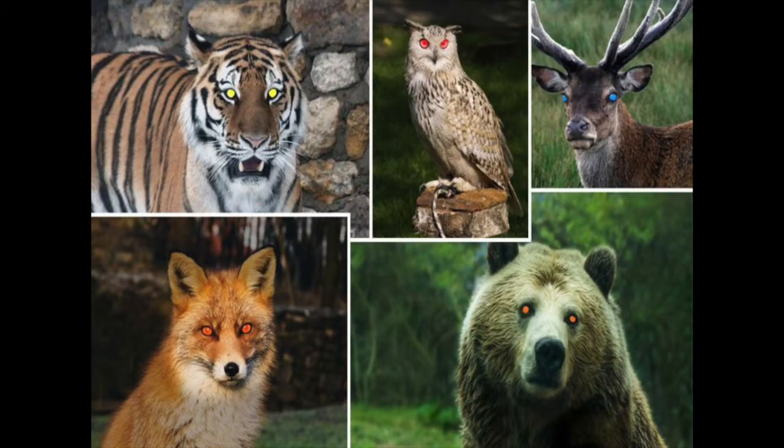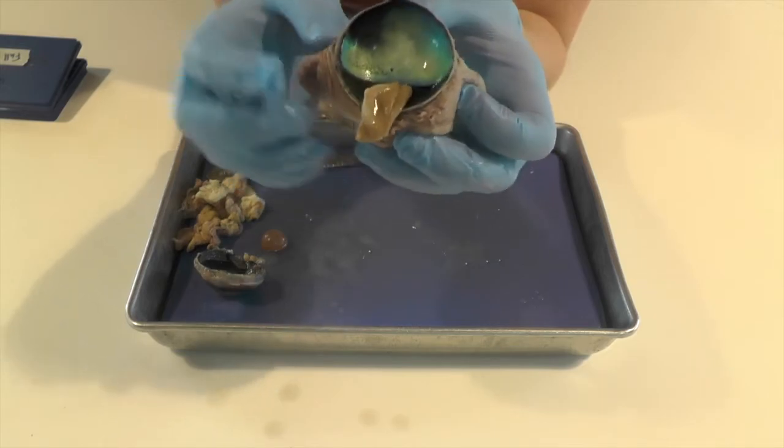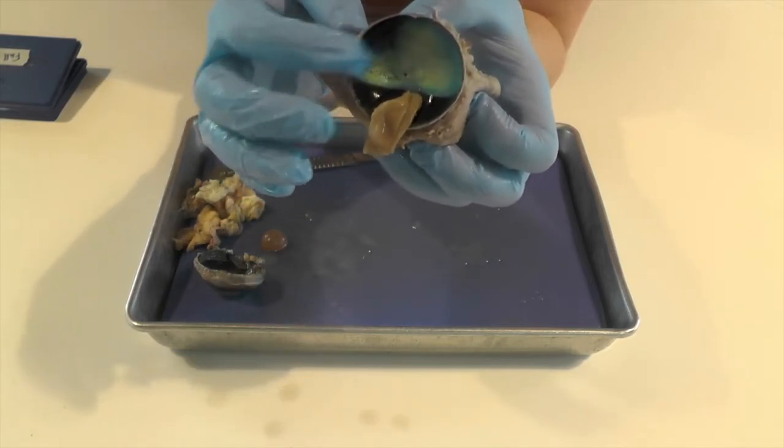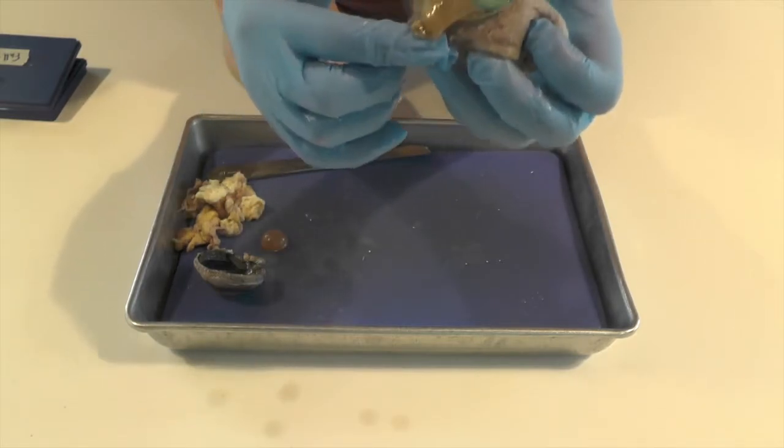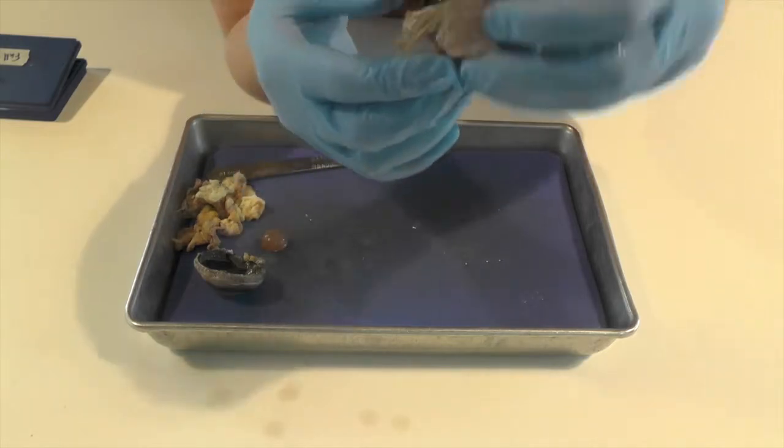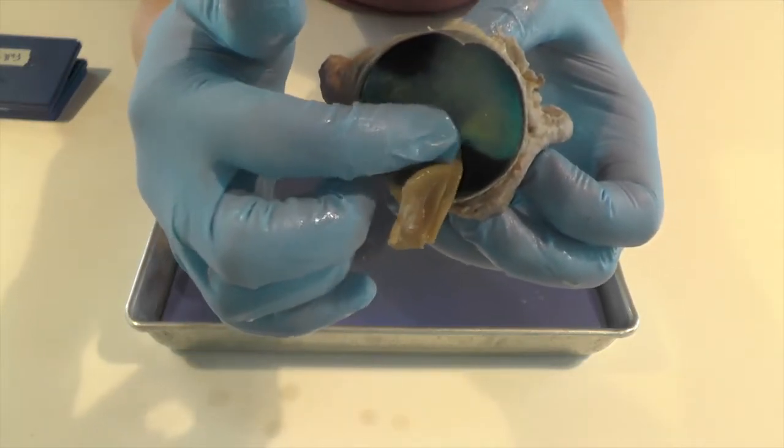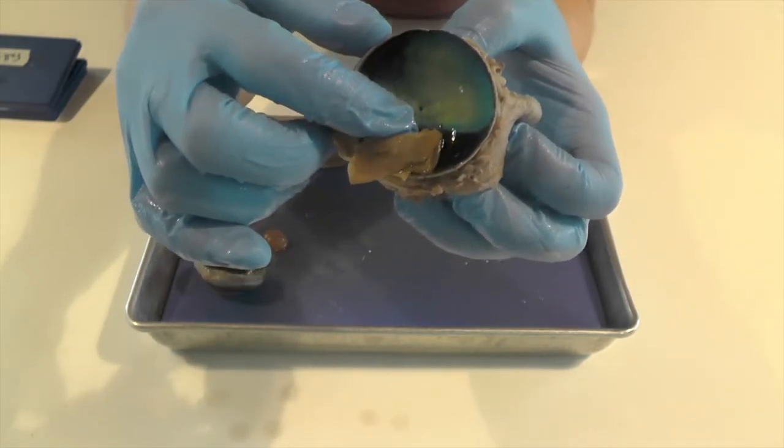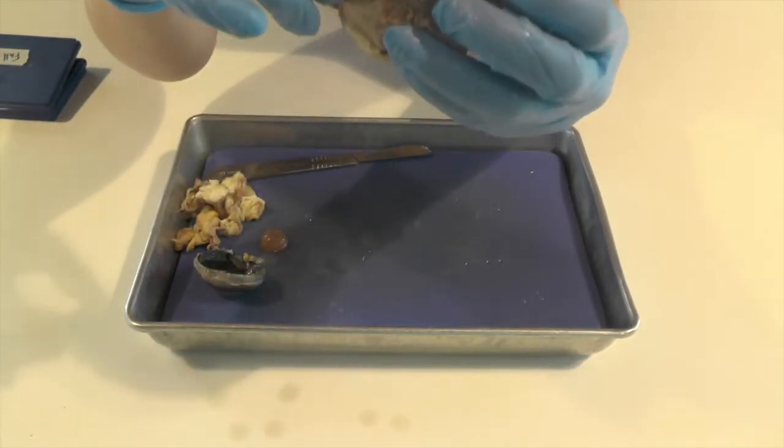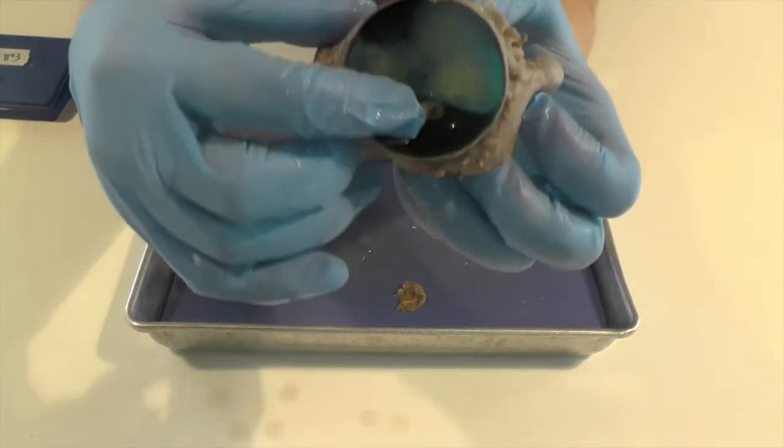So if you think about if you're driving in a car down the road, and you see eyes flashing at you from an animal, that's just the light that's flashing from your headlights back out to you. And that light's hitting the tapetum here. And you'll also notice our retina is hanging on here. And this is the other end of our optic nerve that we saw earlier. So the retina, if I can pull it out actually, scrape it away. Here's the optic nerve.